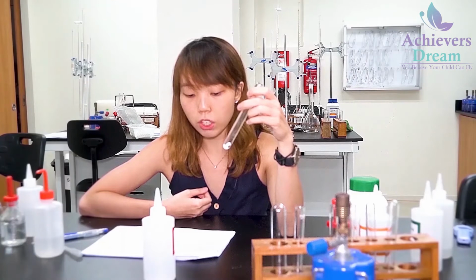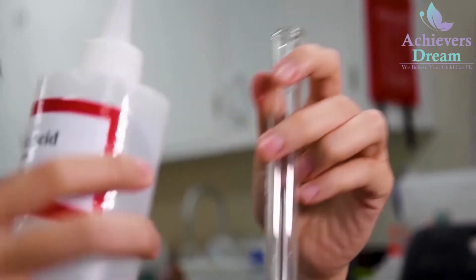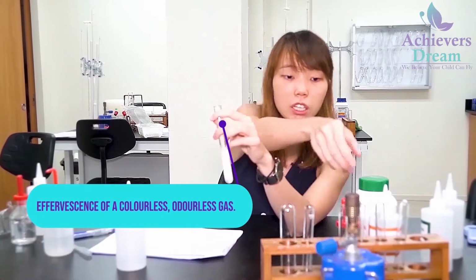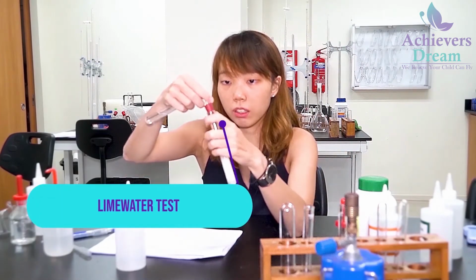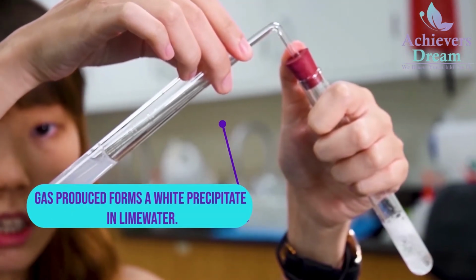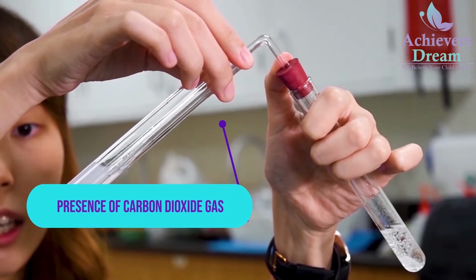Okay, so now for solid Y, step 2A, to 1 spatula of Y in a test tube, I'm going to add in 2 cm³ of dilute sulfuric acid. Upon addition, you'll see that there's effervescence of a colorless, odorless gas, and I'll be doing the lime water test. So you see that there is production of a white precipitate when the gas is bubbled through lime water. So this indicates presence of carbon dioxide.